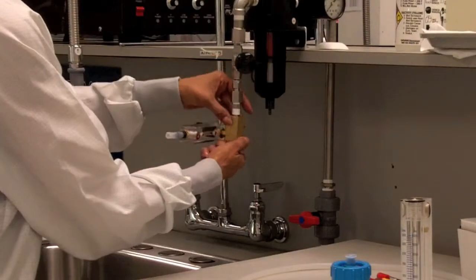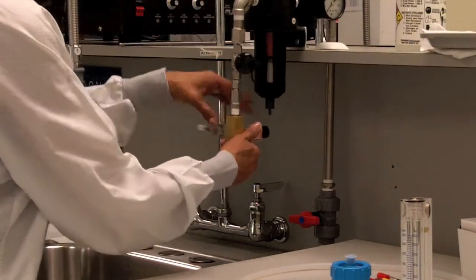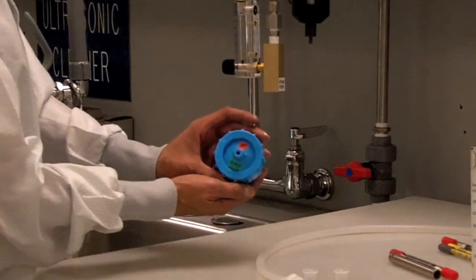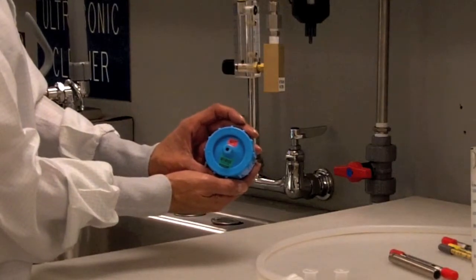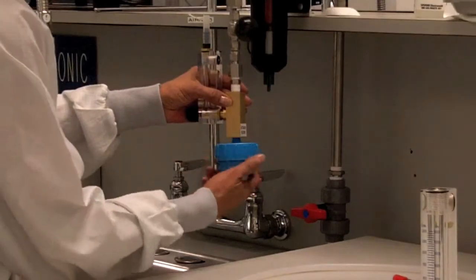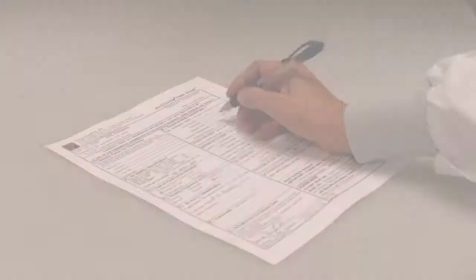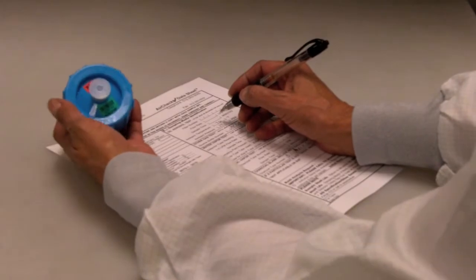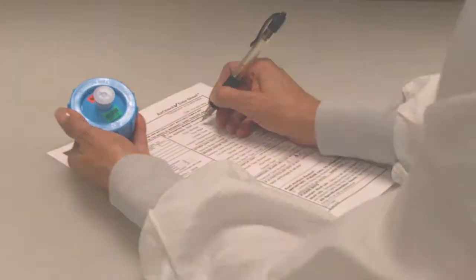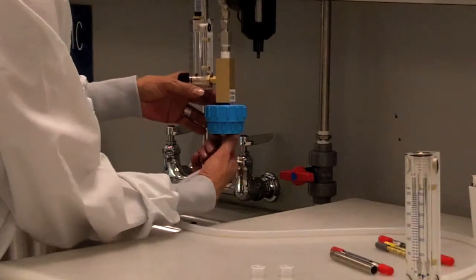Hand tighten the unmarked side of the adapter to the sampling outlet. Attach the filter cassette side marked NPT to the adapter end marked 'attach filter.' Verify that the number on the filter cassette matches the number you wrote down on the datasheet. Attach tubing to the outlet side of the filter cassette.